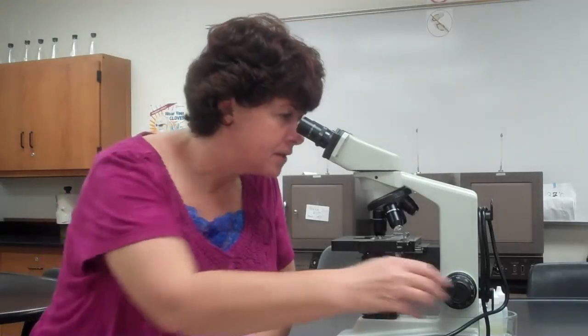So it just depends on the specimen. One of the things that can occur is when you're making those slides, it's going to be a little bit cumbersome and you have a lot of different slides that you're working with. What can happen is students get a little bit out of sorts, I guess is the word, and they put their slide on upside down, okay? You will have focusing issues on the 40 or the 100 if your slide is upside down. So if you can never focus on the 40, go back to the 10, lower the stage, take the slide off and see if it's upside down, okay?